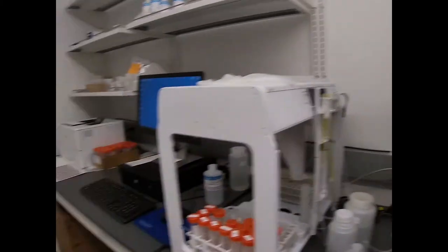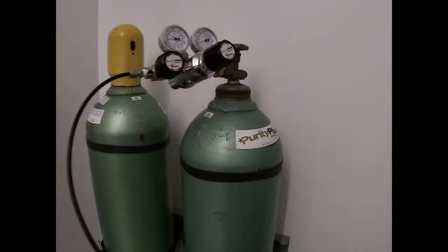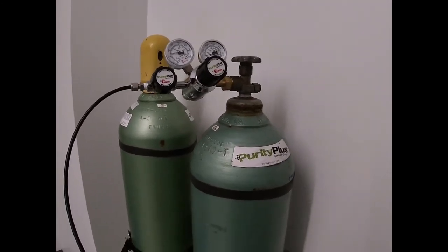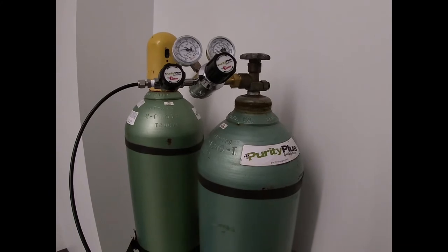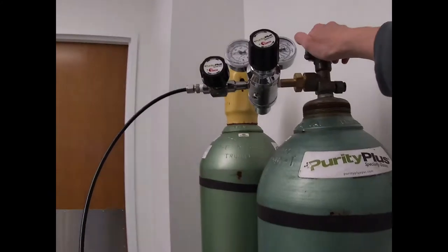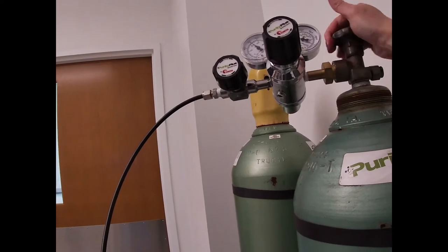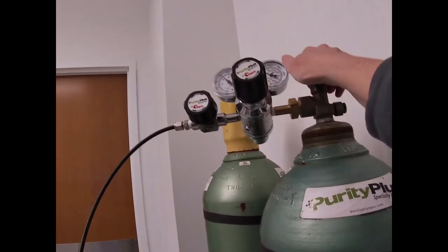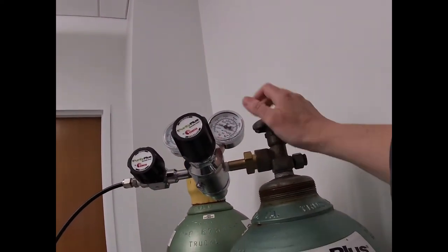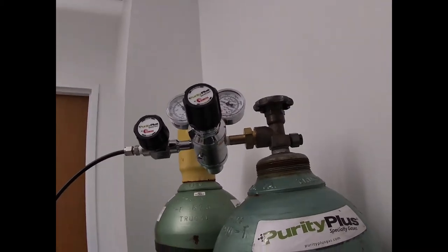Essential for maintaining our plasma is a high purity argon supply. A tank like this will last us about eight hours if we're running the plasma. We need to make sure we open our gas tank. We're low on gas, however, this will last us plenty of time just to get things ignited.